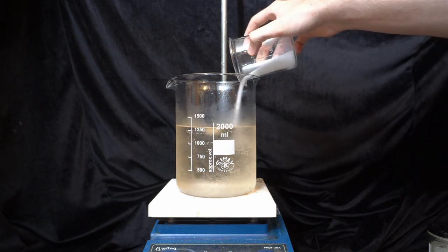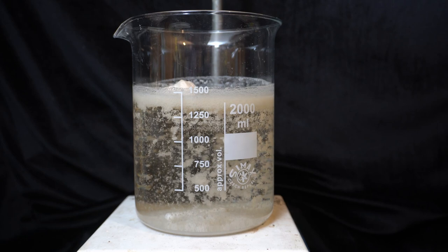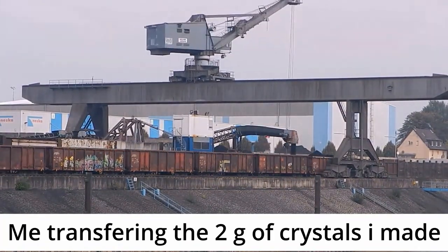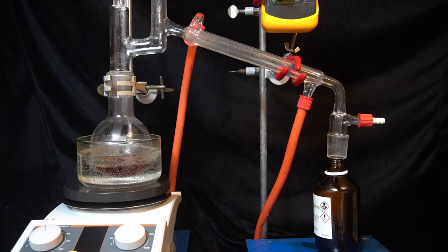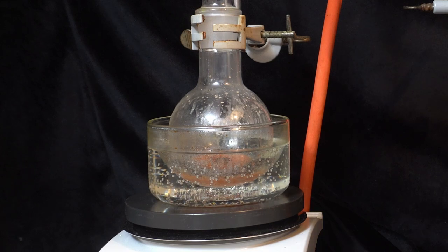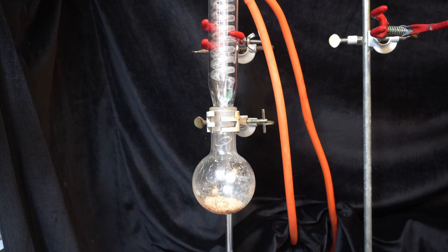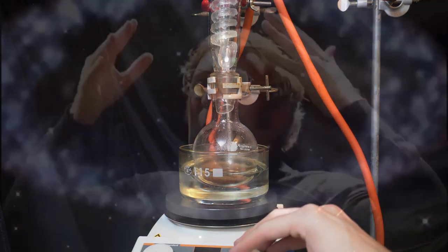To force out the remaining product, I first saturate the solution with a whole bunch of salt — and already there's a lot of product precipitating. Then I extract it all with some DCM in my big separatory funnel and remove the solvent via distillation. To get rid of the last bits of solvent I pull a strong vacuum. The result is very brown because all of the impurities got extracted as well, but I'll just recrystallize this again. This time I learned from my mistakes and will use an ethanol-water mix — yes, I am capable of learning.